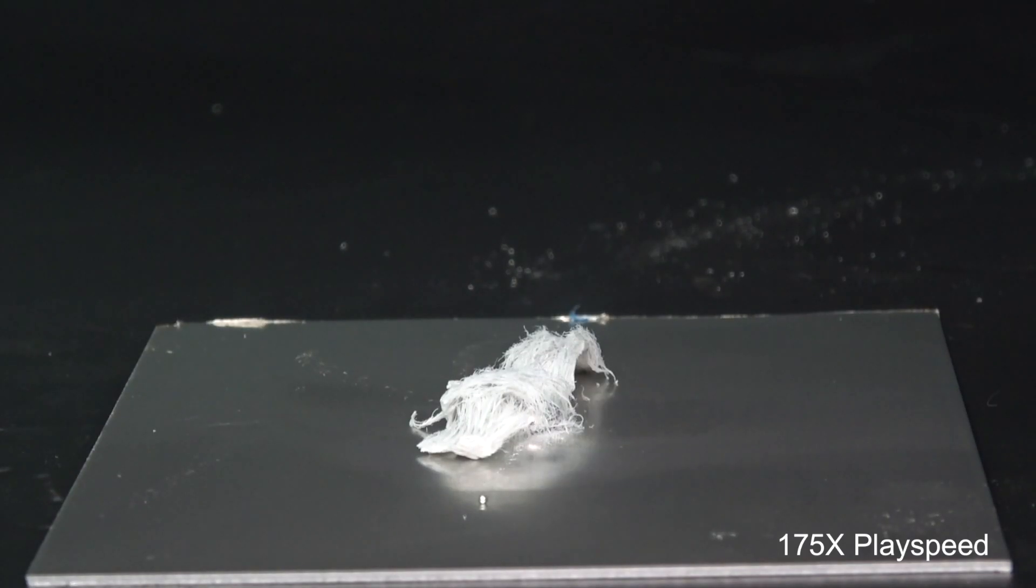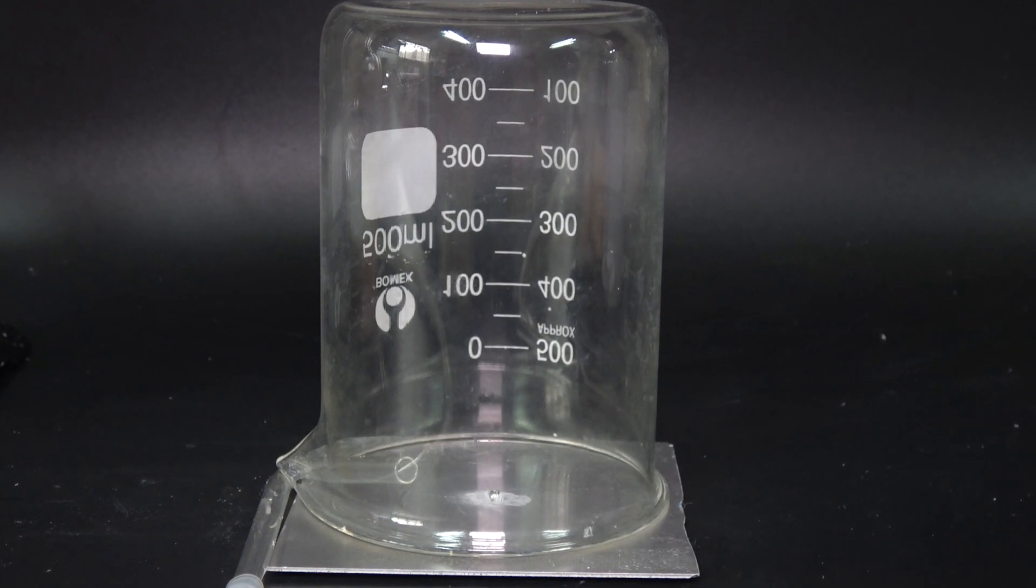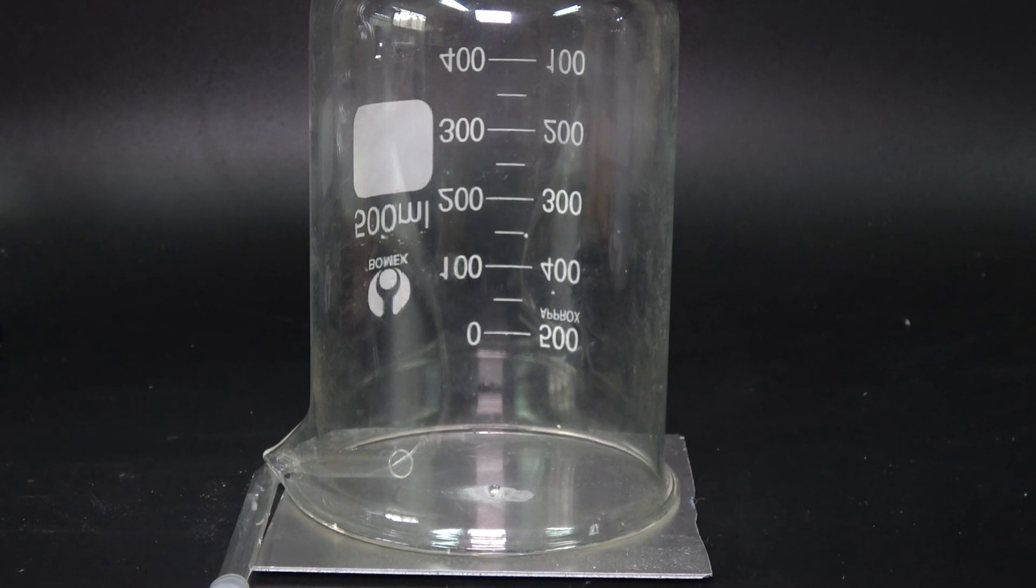Since my prediction for those mysterious fibers is the product of the reaction between aluminum and the oxygen in the air, I wondered what if I expose the amalgamate to a higher oxygen level? Will the fibers grow at a higher rate?